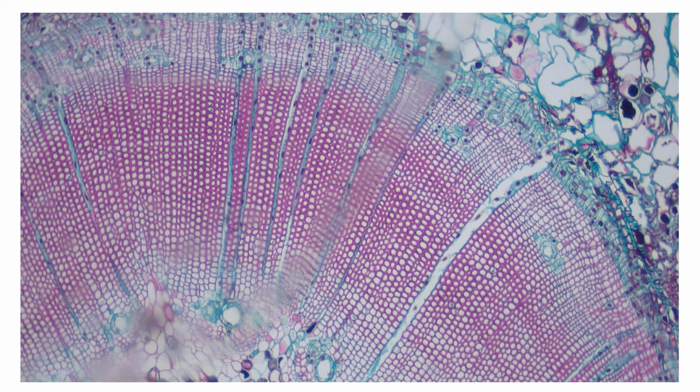Here we go. Here's the zoomed in version, and this does give us a little more detail to what's happening, and you could see this or the zoomed out version on the test, so be prepared for both. You should be able to recognize the cell you're looking at, whether it's xylem or phloem, what the function of it is, so function of xylem, function of phloem, based off identification, and what phylum it is in.